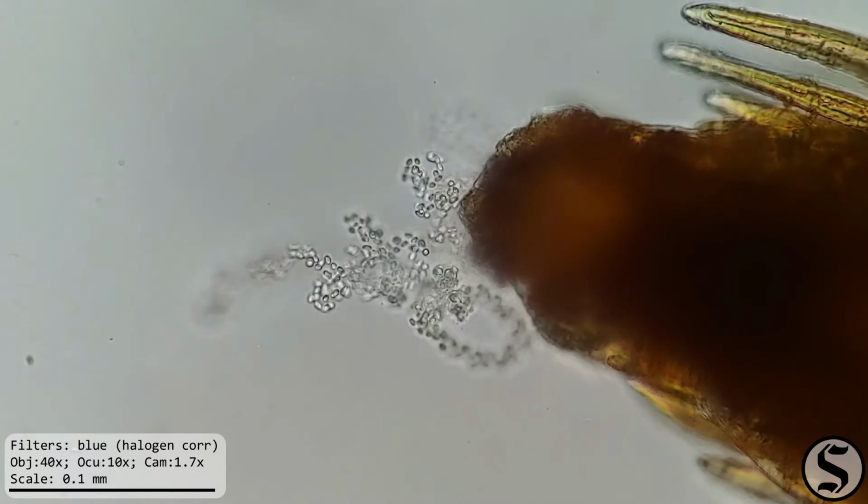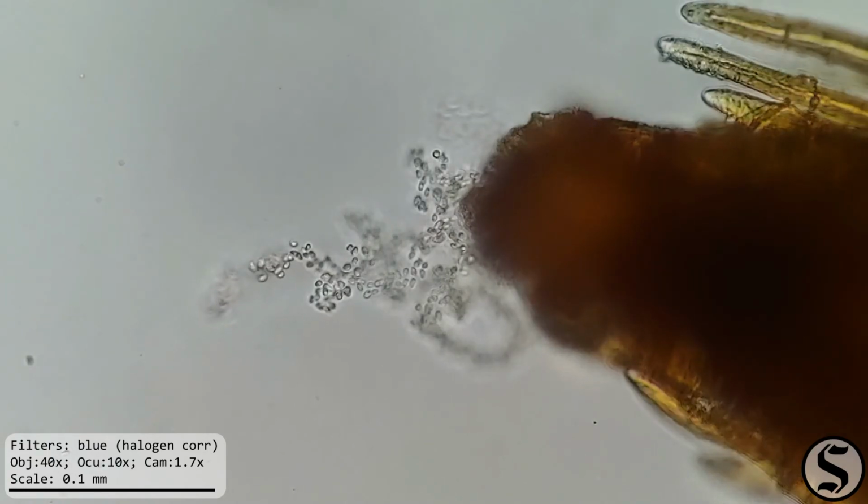Well, that's pretty cool. I wasn't expecting to see anything like that under here. Well, I don't think I can top that level of excitement, so why don't we leave it there for today?